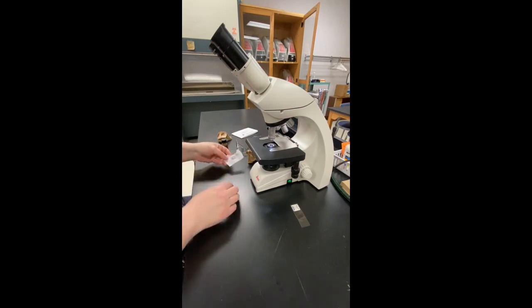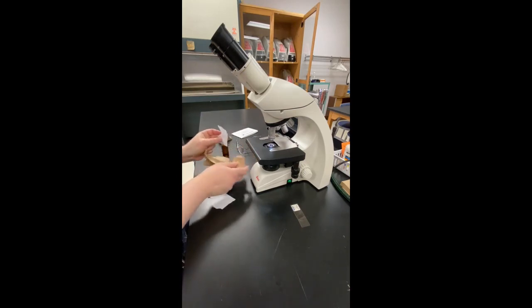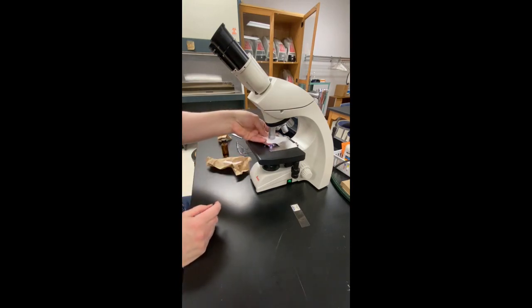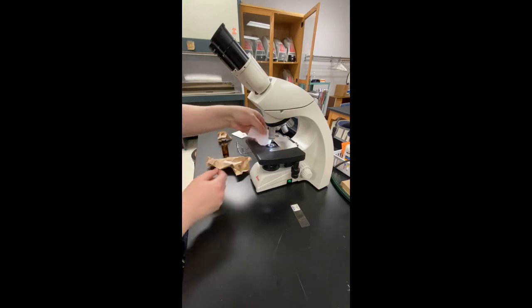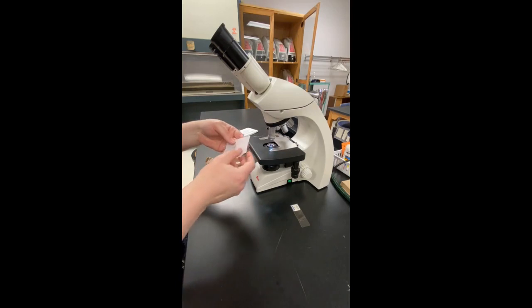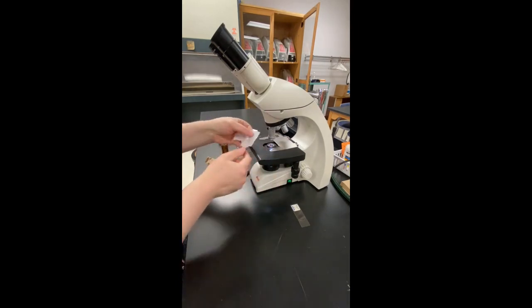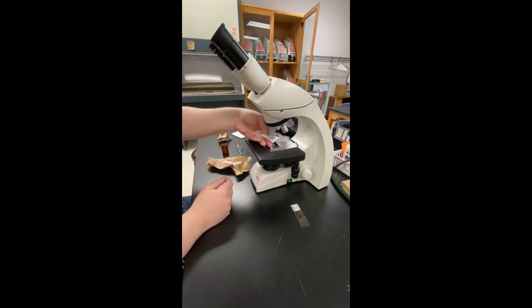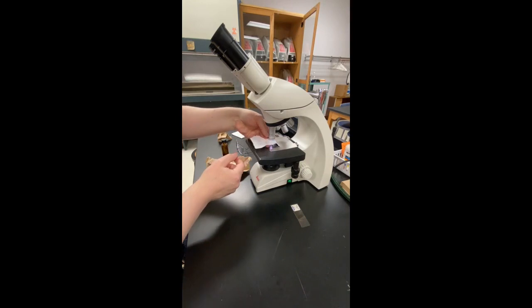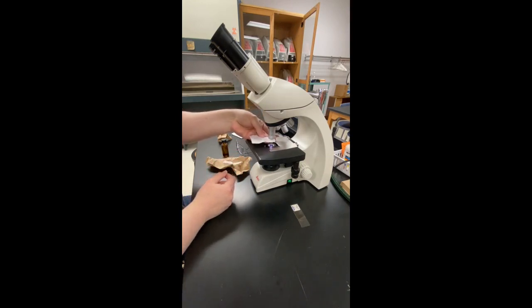Avoid putting the oily paper directly on the bench, as the bench will get oily. Take every precaution to stop the spread of oil. Here is where I should have started to use a fresh piece of tissue. I could have ended up wiping oil back on the lens.